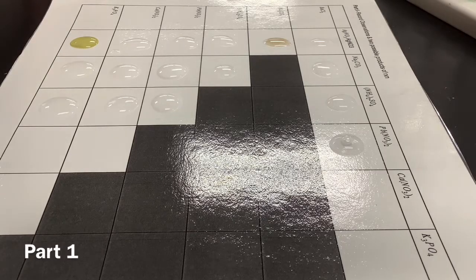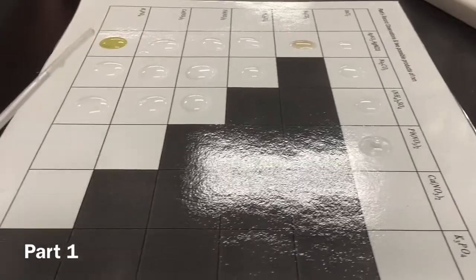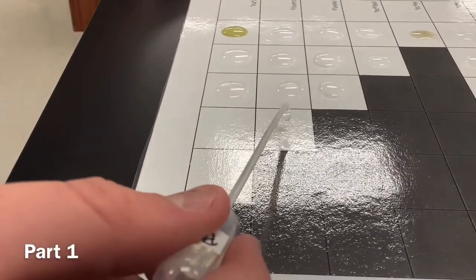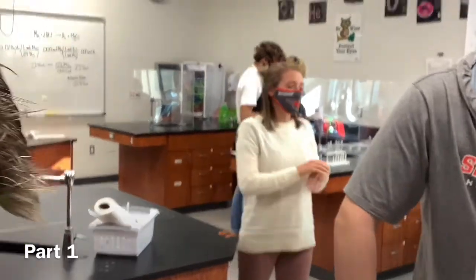But you gotta get used to disappointment. Wait, timing, everybody, make sure to do all your reactions first. Because if you need to, you can do the other stuff at home, like the balancing, but you can't do chemicals at home.